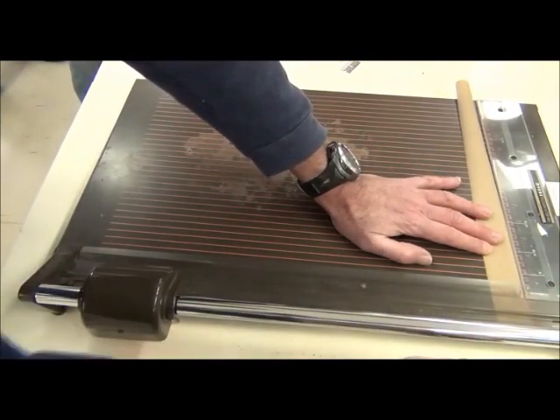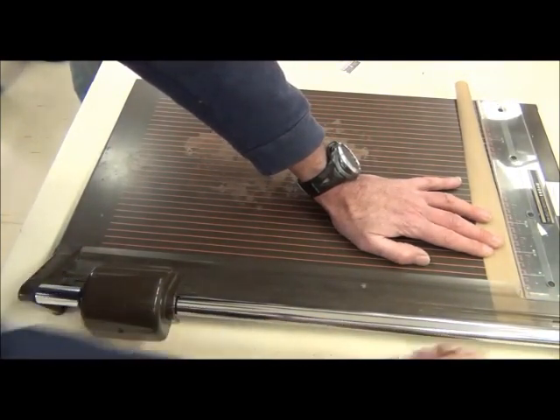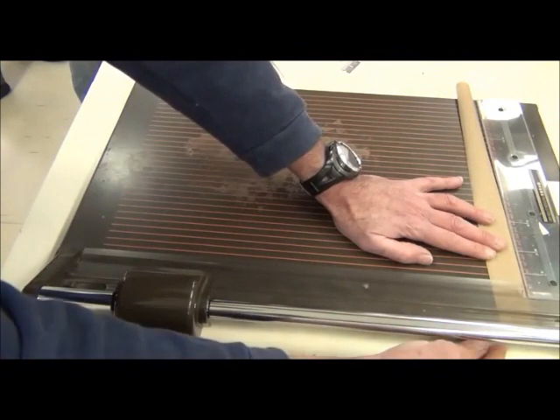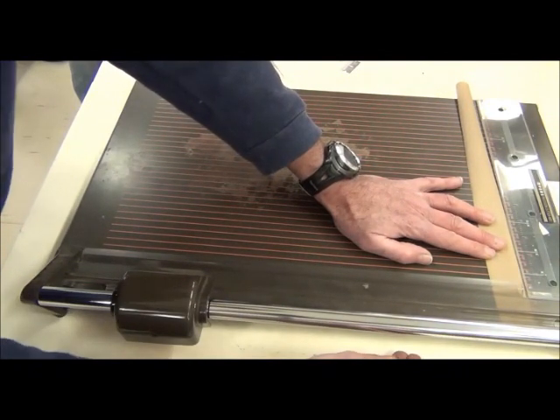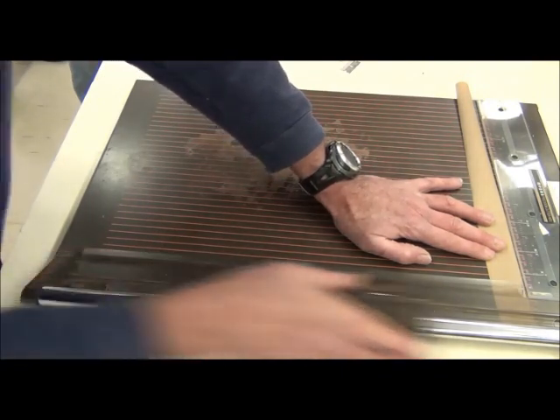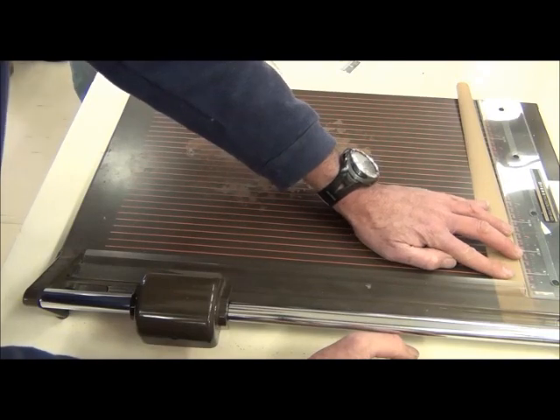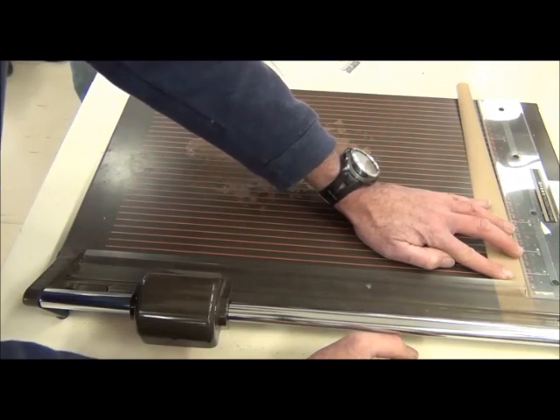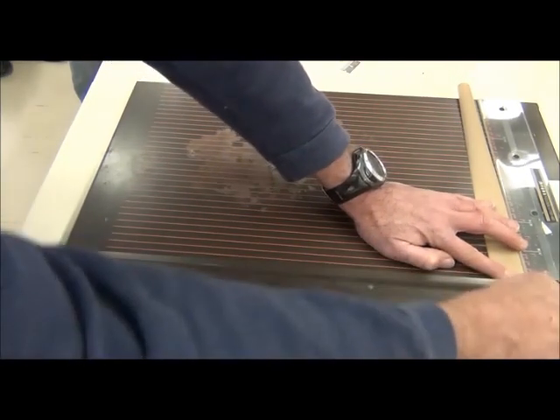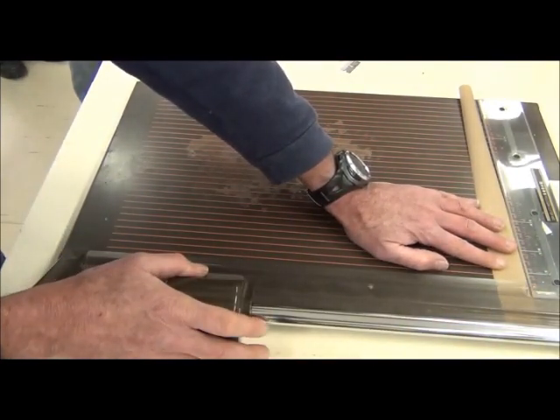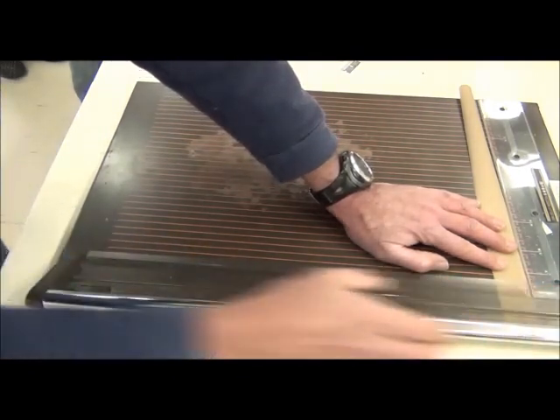I also want pieces that are a bit narrower, about two and a half millimeters wide. You can see that I'm not measuring, I'm just doing it by eye. But at first if you're unsure you could just do some by measuring them until you get a feel for it and then you're off and running.